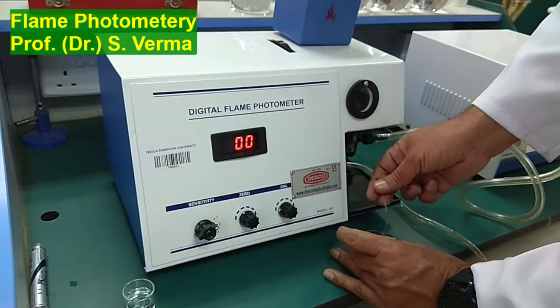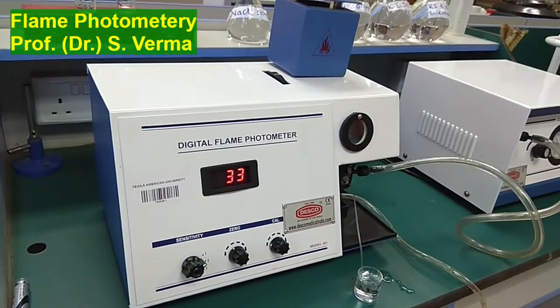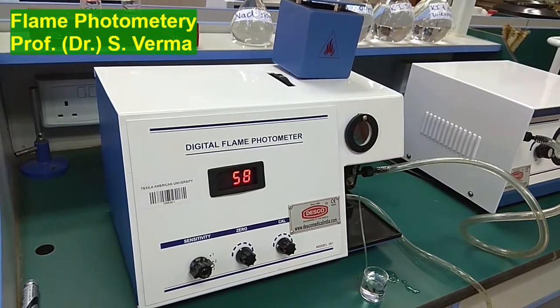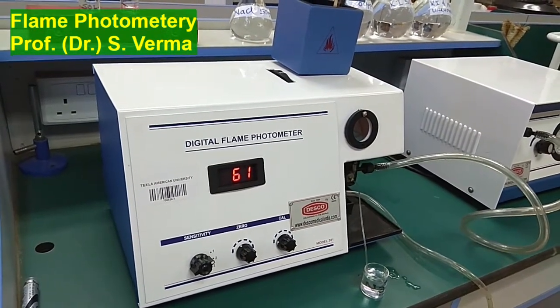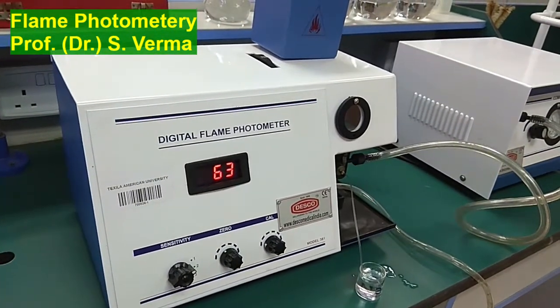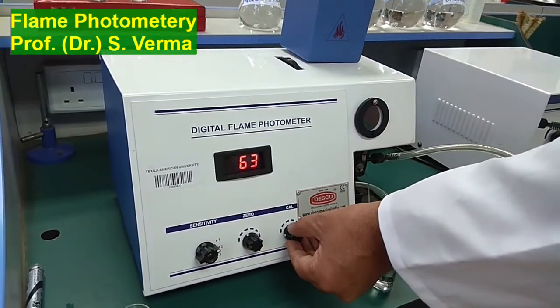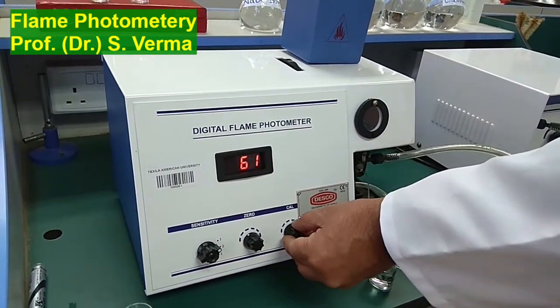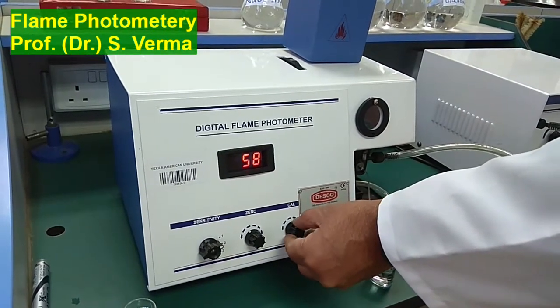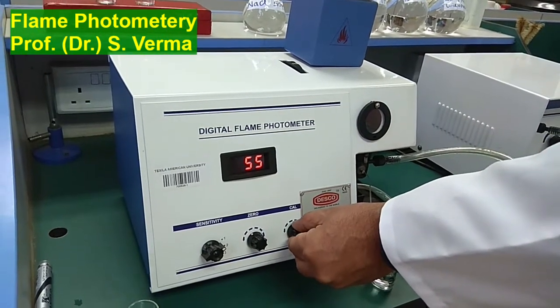So I'm dipping this in, and I have to wait and see where it goes. It's reading 63, so that means I have to adjust it to 50, so that the instrument is calibrated to the desired value, which is my standard solution value. So I'm bringing it to 50.